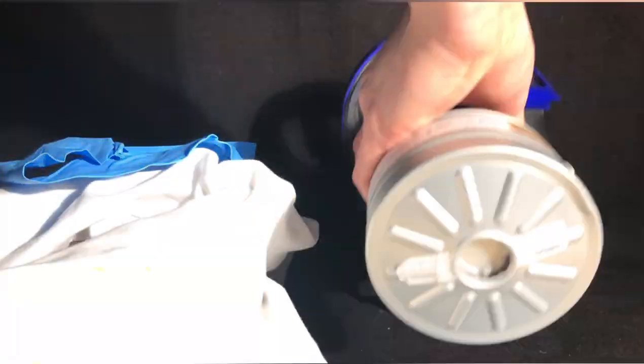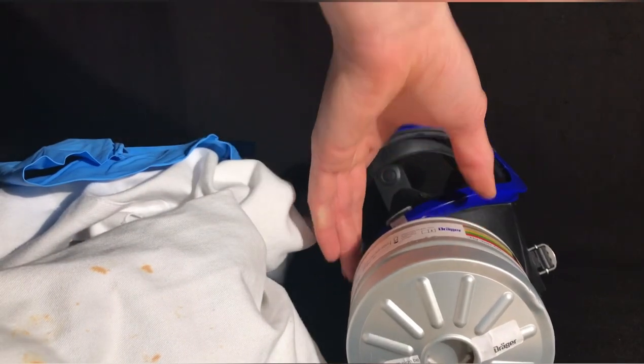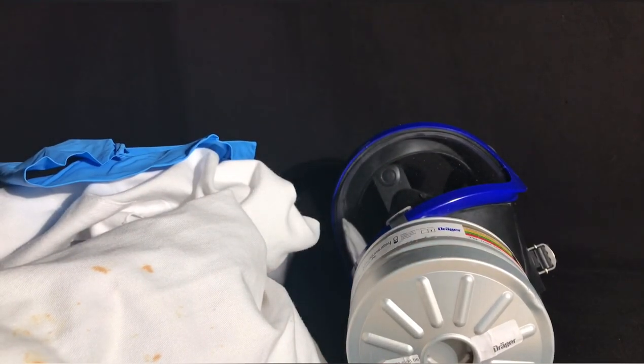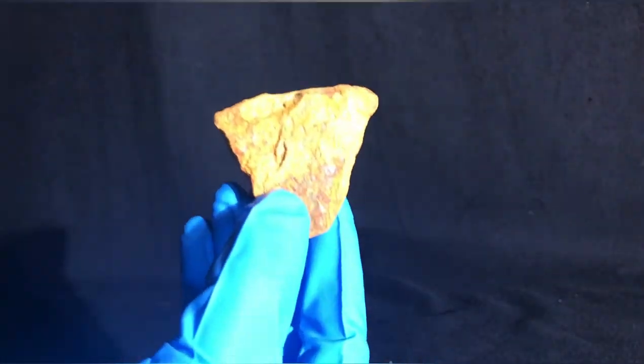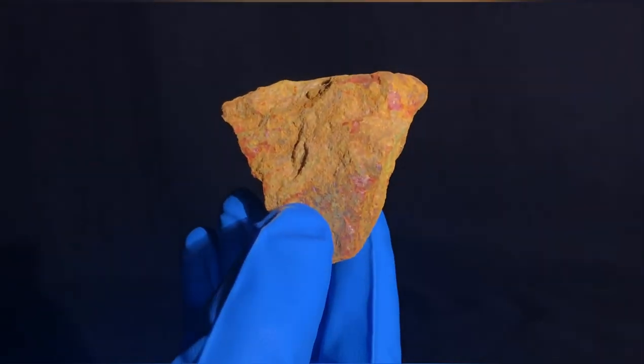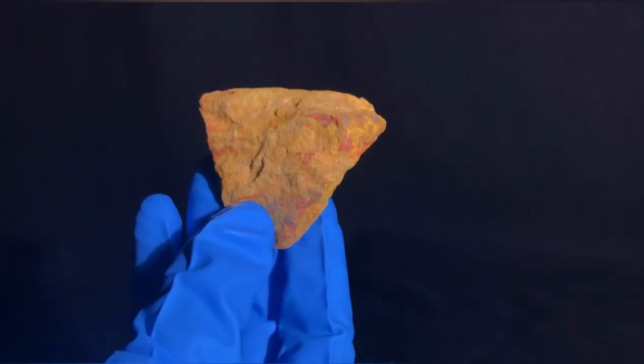For our own safety we are going to wear a lab coat, nitrile gloves, and a gas mask throughout the entire procedure. Because of its poor water solubility, arsenic is somewhat safe to handle in its metallic form. It should still be handled as if it were highly toxic because of the formation of toxic soluble oxides.